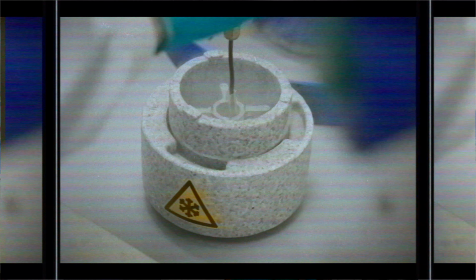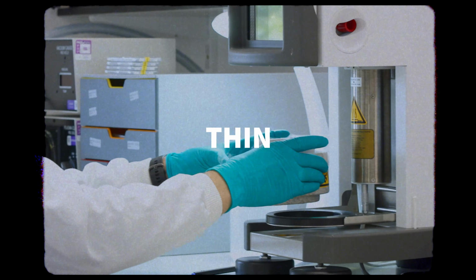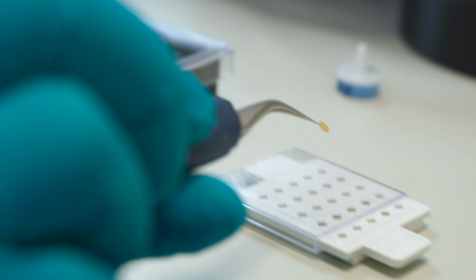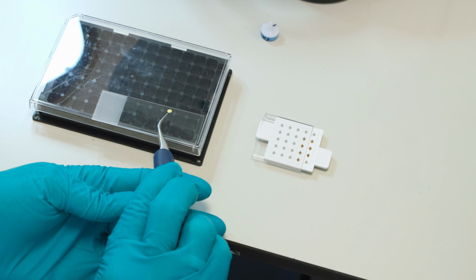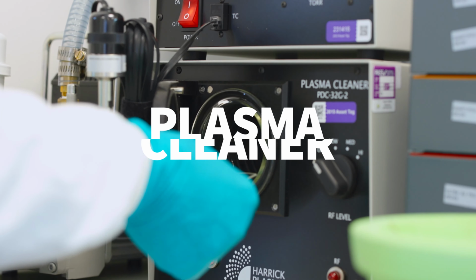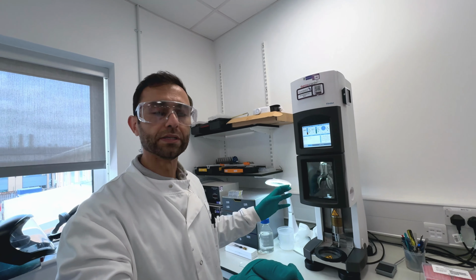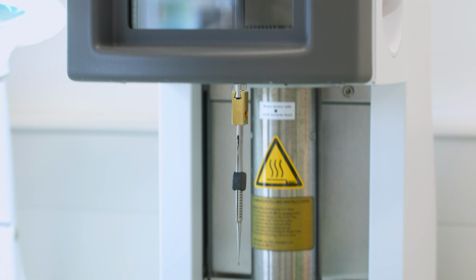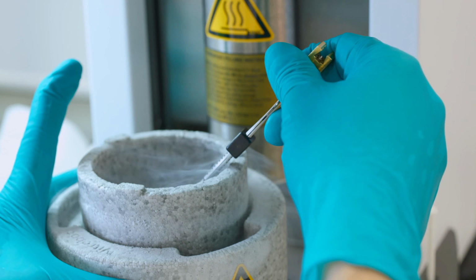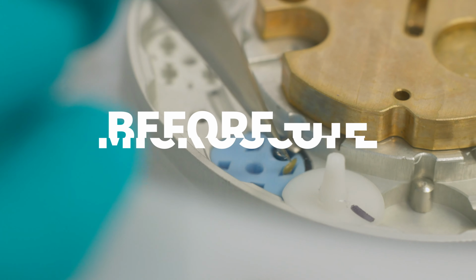Now we have the protein fully characterized. The first step is to freeze the protein in a very thin layer of ice, and we will be able to image them using cryo-EM. And then I'm going to take the grids one by one and deposit them on this cover slip. Starting here is a plasma cleaner to get it ready for the freezing step. There's an important piece of equipment for the plunge freezing, and we will try to freeze the protein in, again, cryogenic condition. And the last bit would be preparing the grids for screening for the microscope.